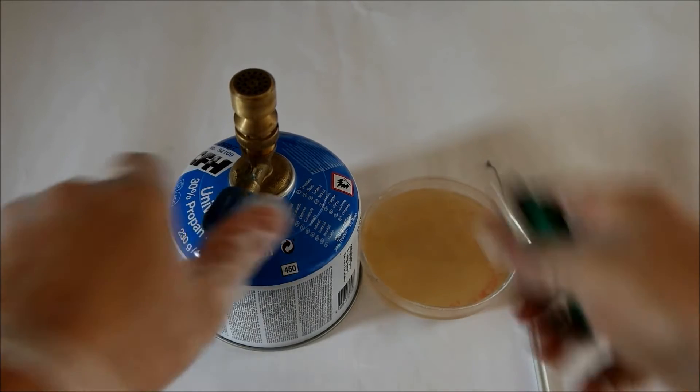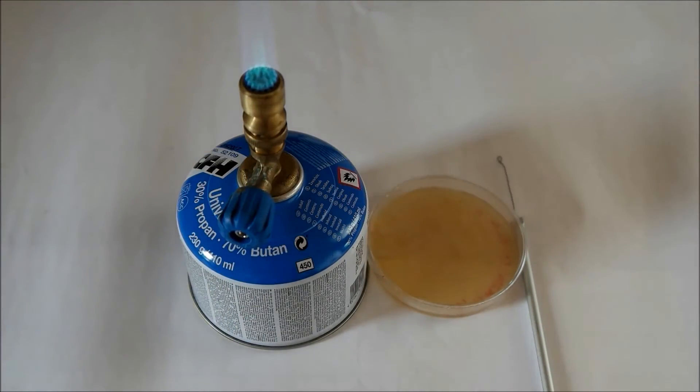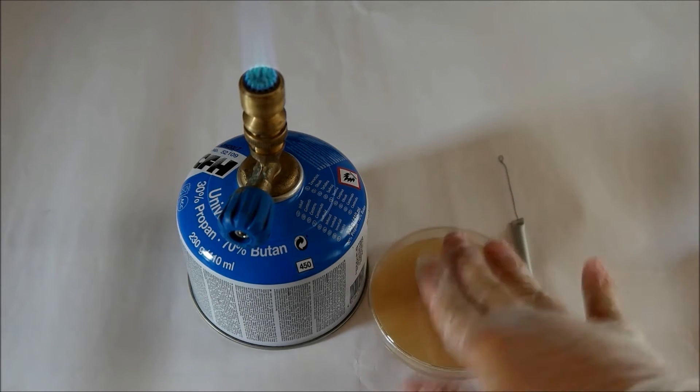Now light up the Bunsen burner and keep it near your place where you work with the bacteria.